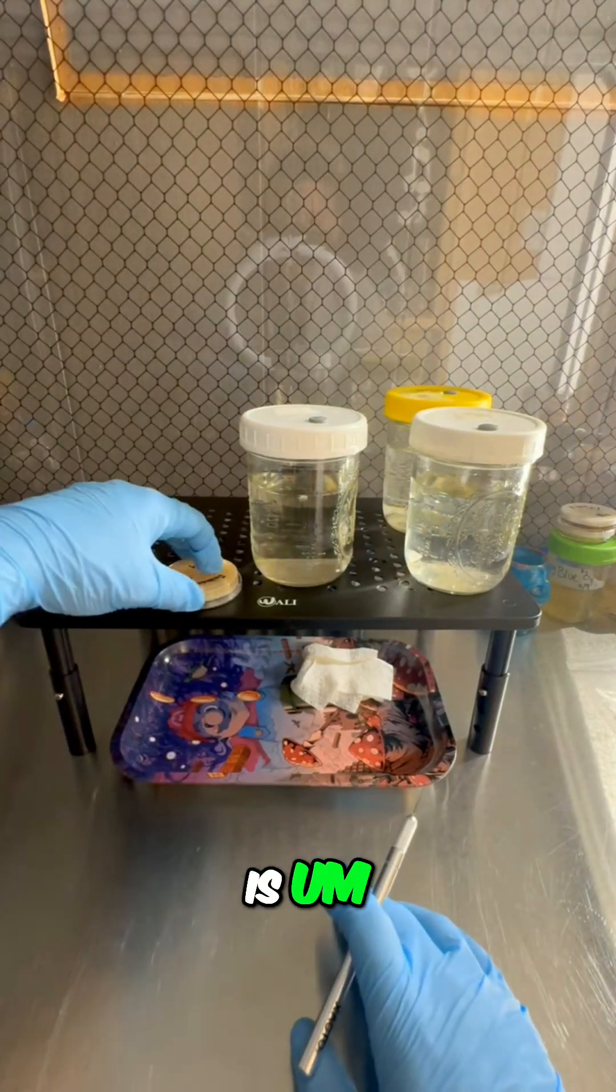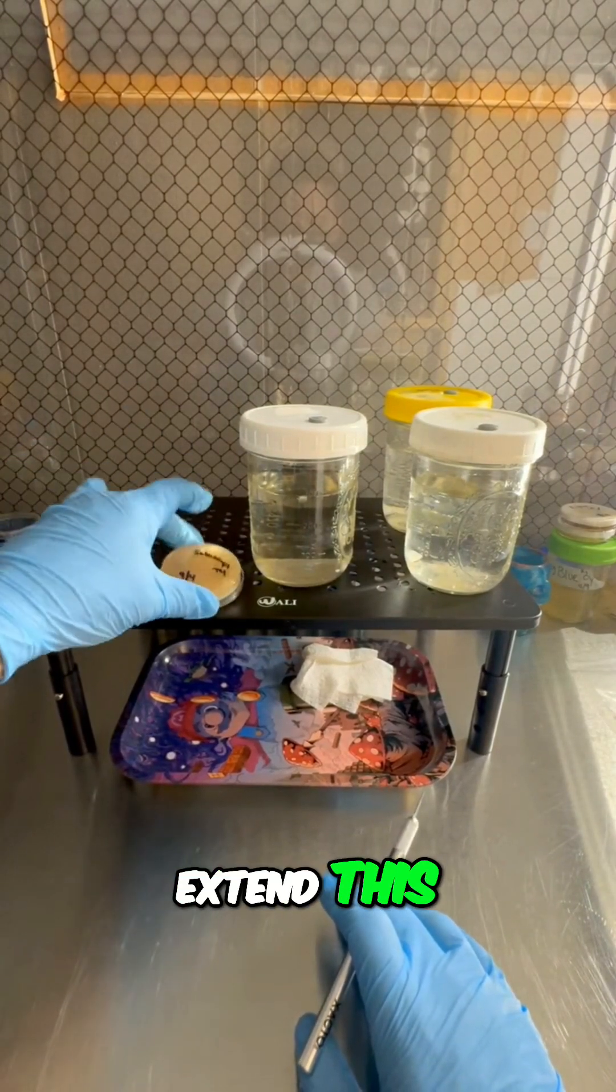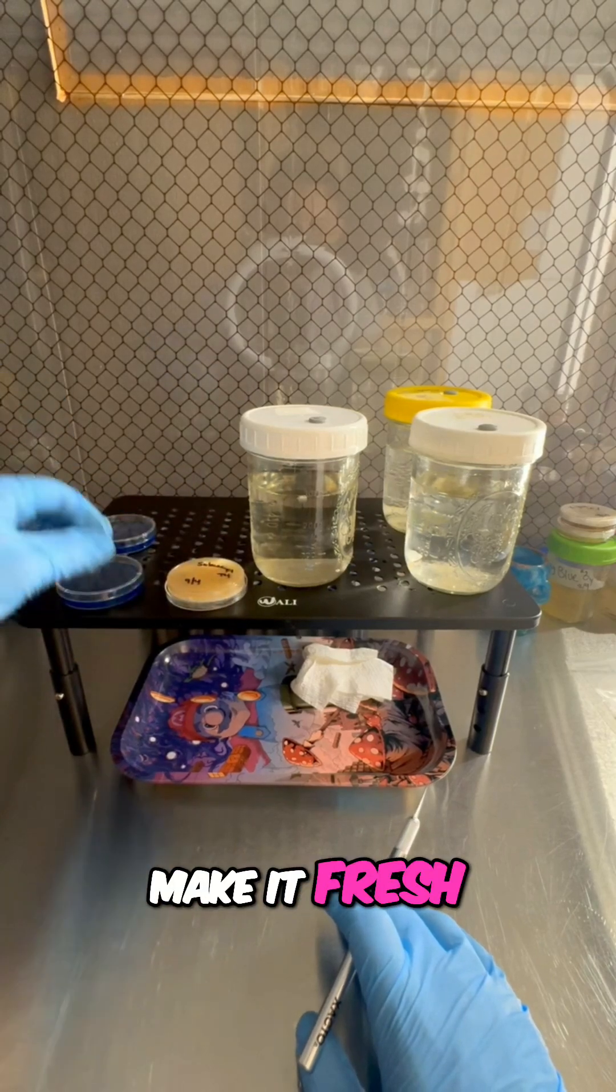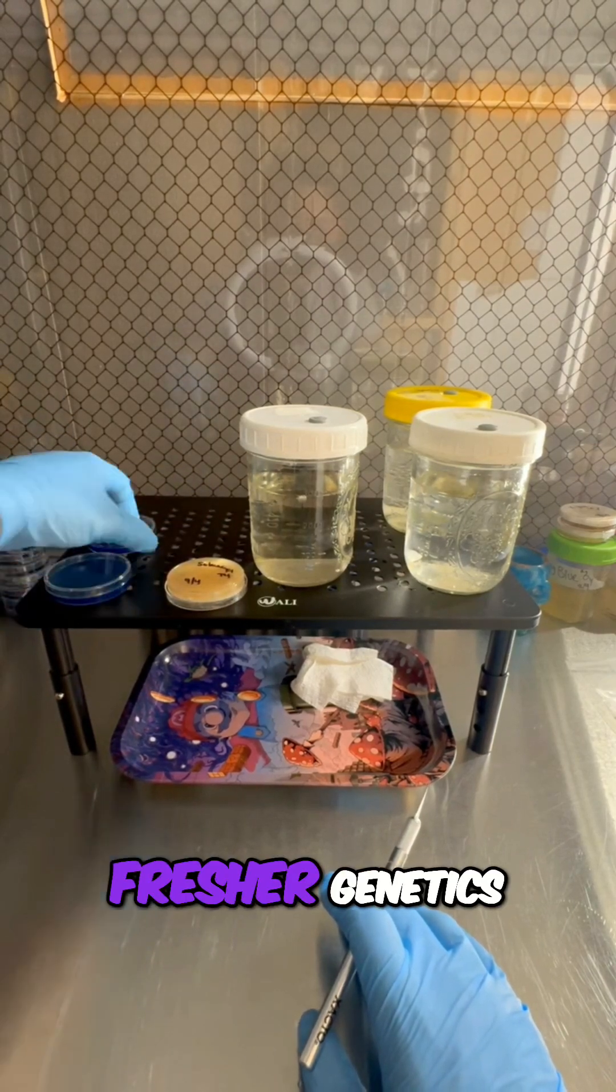All that's gonna do is extend this culture and make it fresh. I'm just gonna have fresher genetics on it.